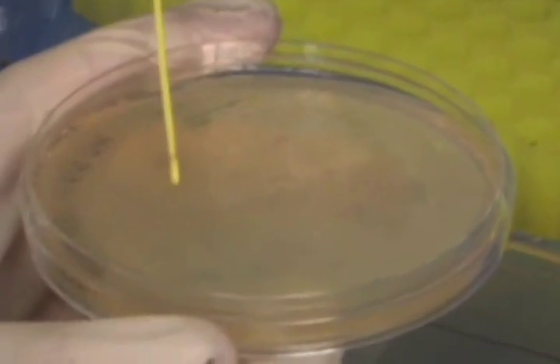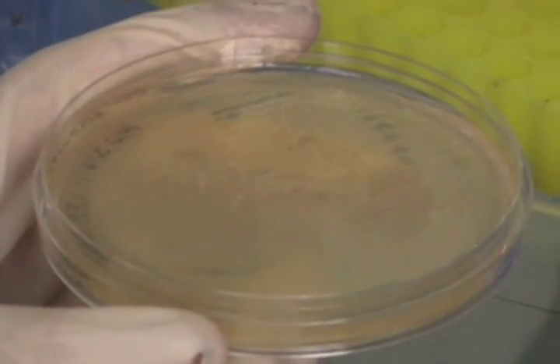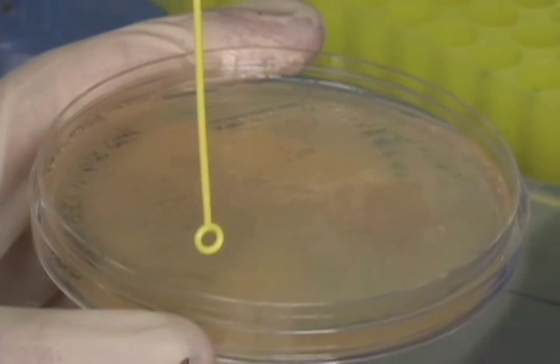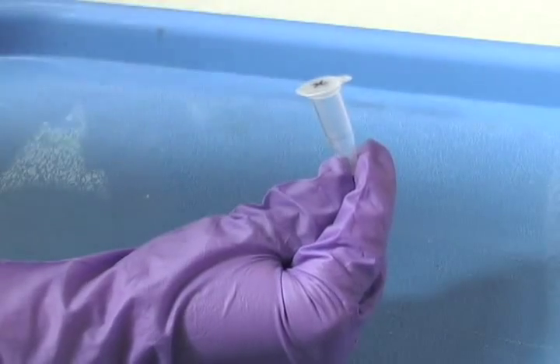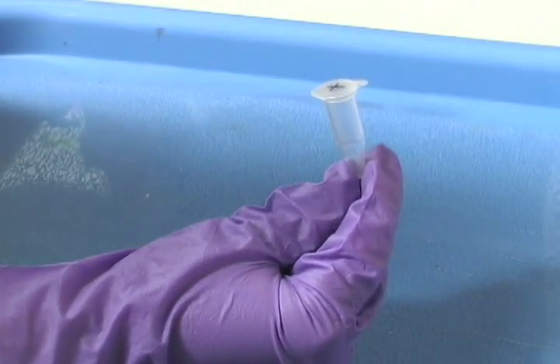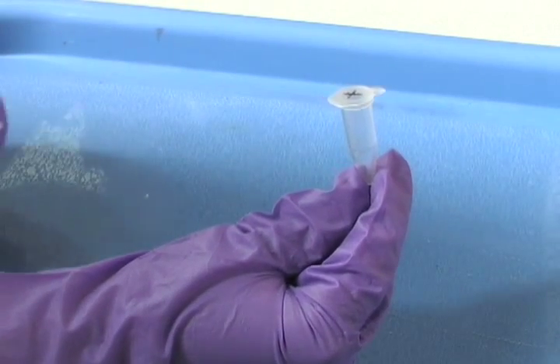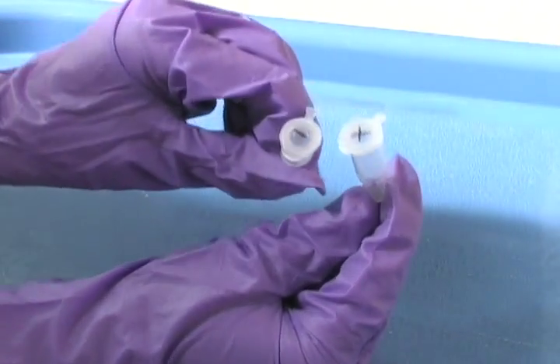We'll be performing bacterial transformation with our newly created mutated plasmids. Yesterday we created primers containing a mutation. Then we used that primer in PCR to create millions of mutated plasmids.